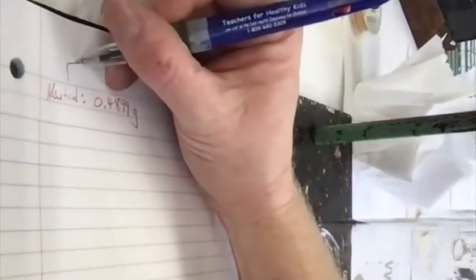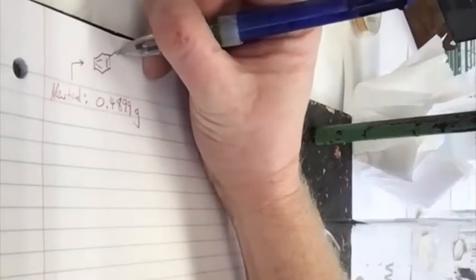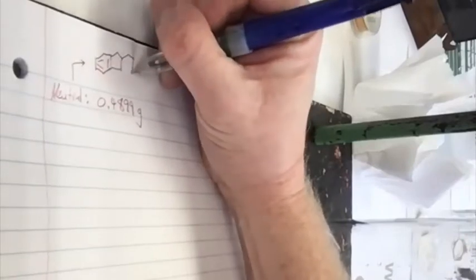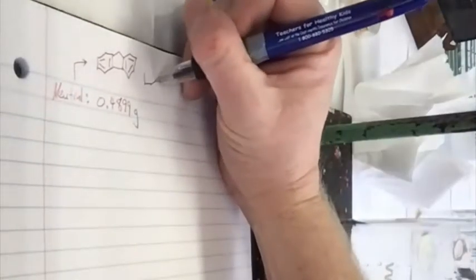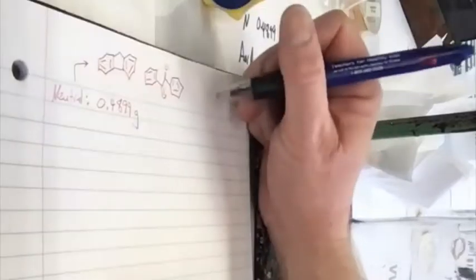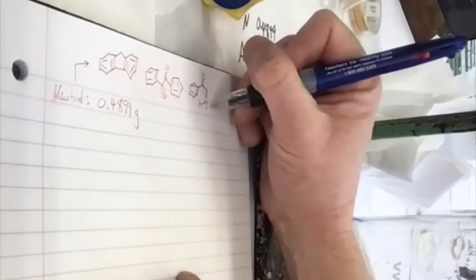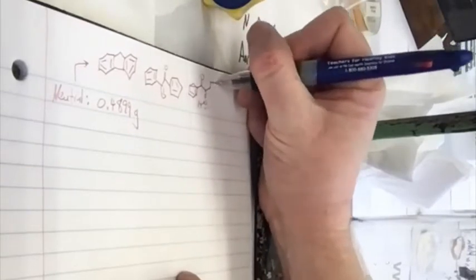This neutral compound could be, as I said, like fluorene, which has two benzene rings that are connected by a 5-membered ring like this. It could be fluorene. It could be benzil. That's the same one we had last time. It might not be that one since we already did that one. Or benzoin, a racemic mixture. Actually, it's got a stereocenter. We bought the racemic mixture because it's less expensive. Okay, so it's one of those.